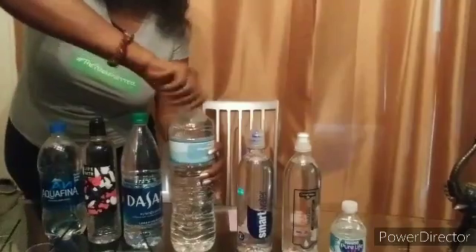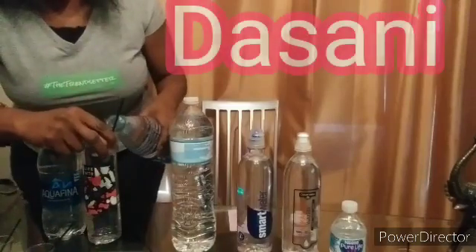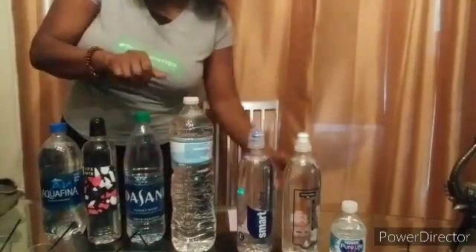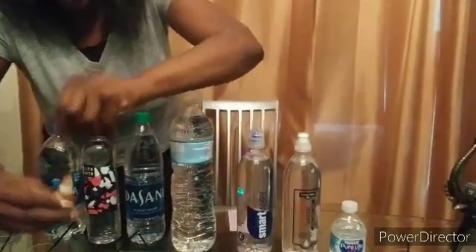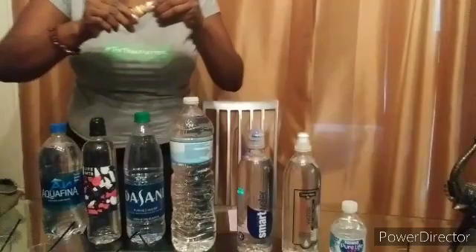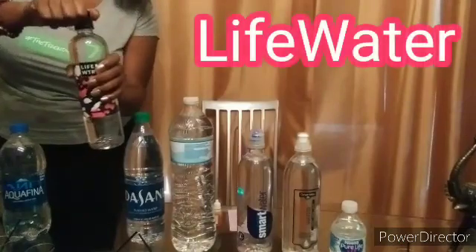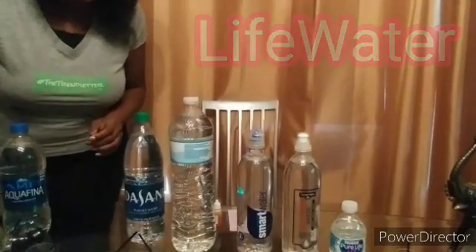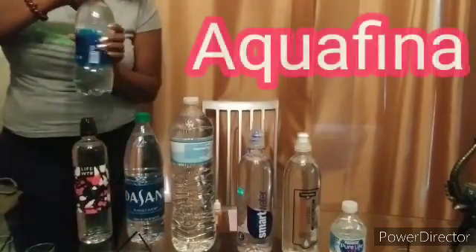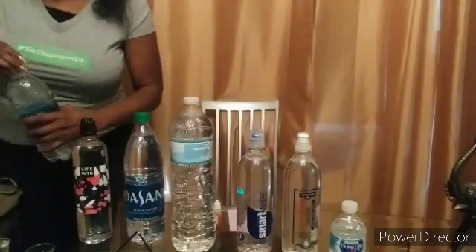It's only water - that's what tissue is for! This one here is Dasani; I know a lot of people drink Dasani. I'll put that one there and give each two drops: one, two, one, two. Then we'll move on to the last two. This one is Life Water - I know a lot of people drink Life Water too. And this last one is Aquafina. I drink the Nestle Pure Life when it's very cold, I love it, so I'm hoping it's good.